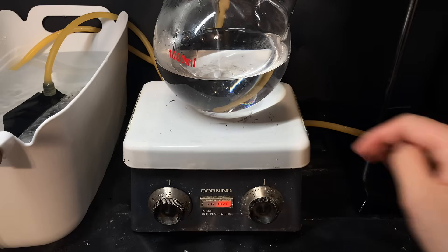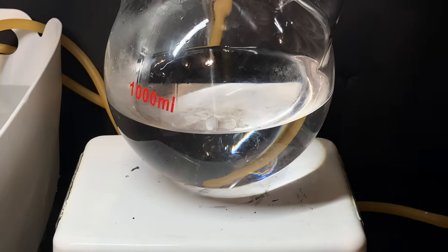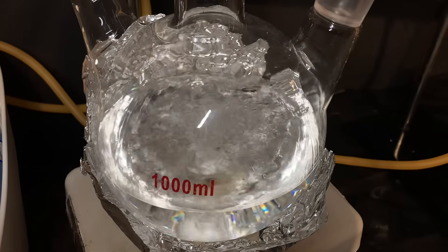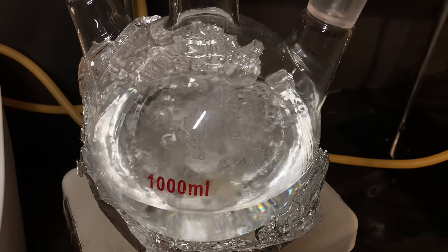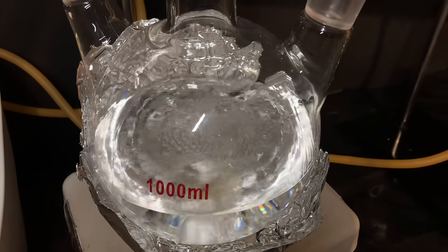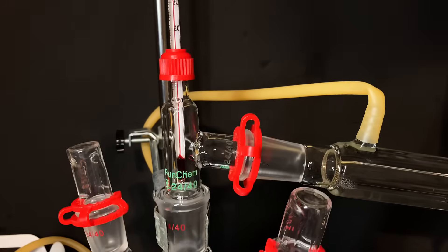Now with my stir plate and the massive amount of alcohol that had to reach boiling, it took forever to start, but when it did, it really was a bubbly one. I also insulated it with aluminum foil to make it more efficient because I realized by then that this process is going to take a while.